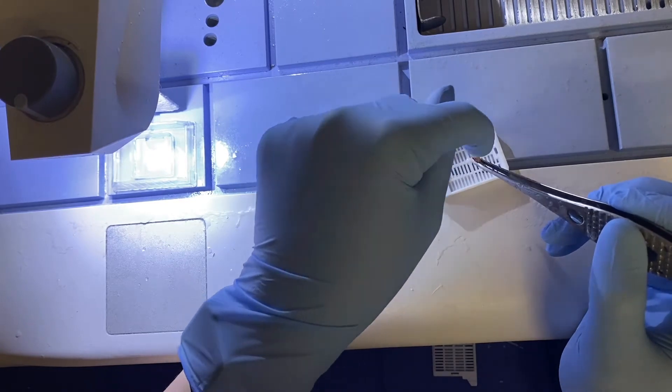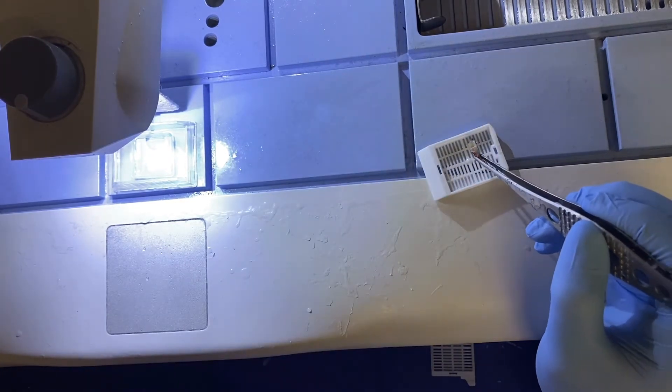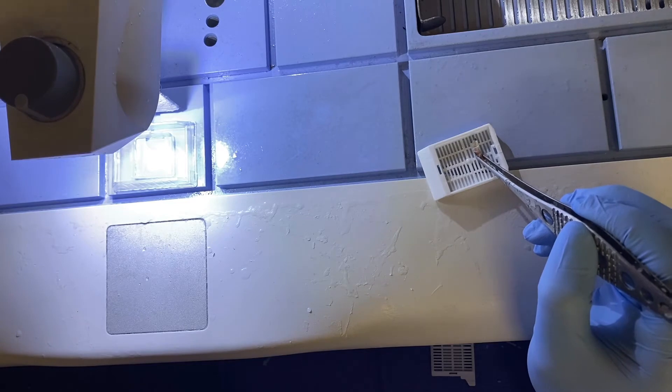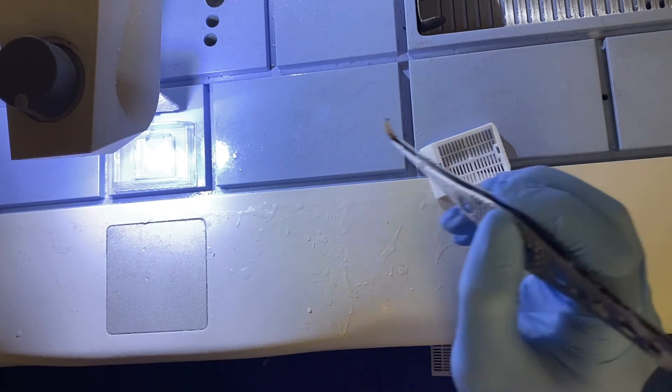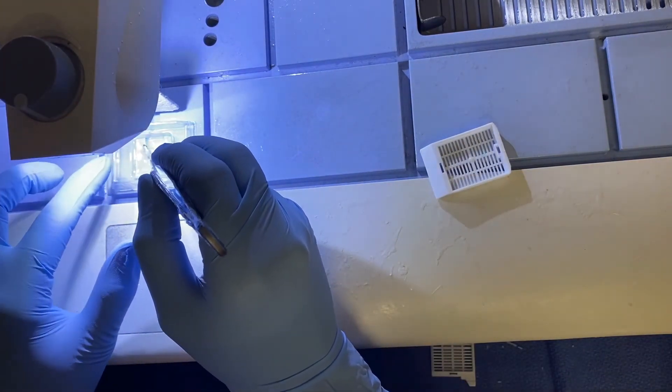And you can see this relationship and we would see all of the layers of this wall. So we're going to pick it up just how it was in the cassette after it's been processed and put it on its side on edge.